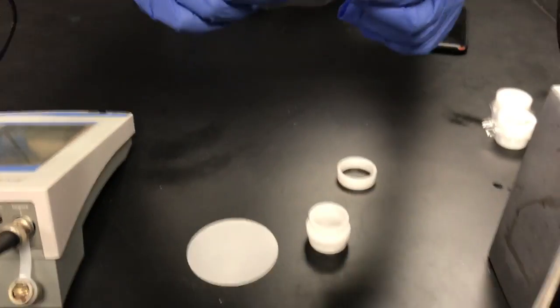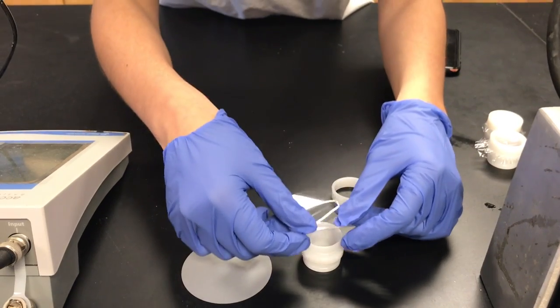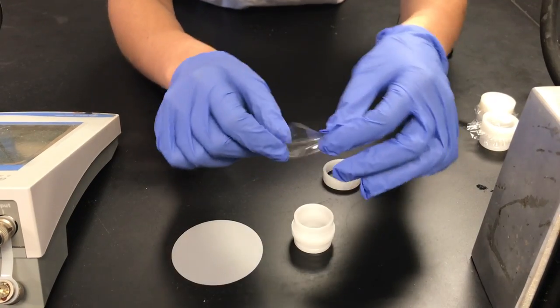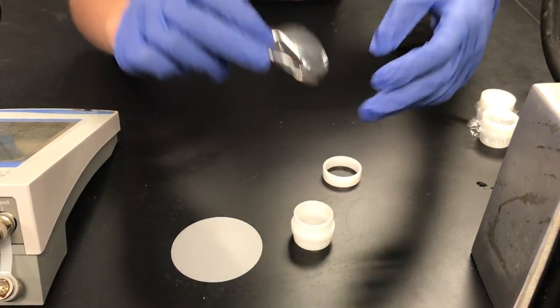Okay, I want to do one. My turn. Here you go. Oh, so this is like, okay, so now it's my turn. So you put the plastic... okay, it is static. Oh no, you're right, this is hard.